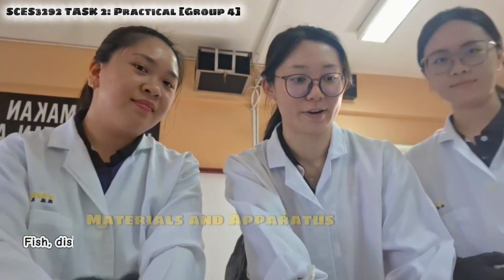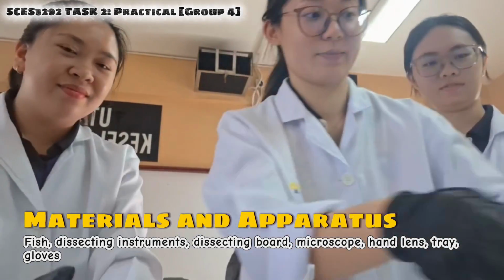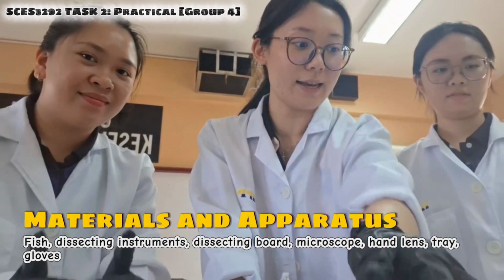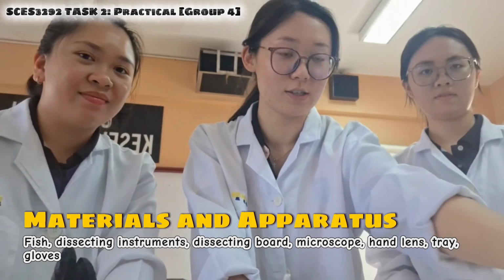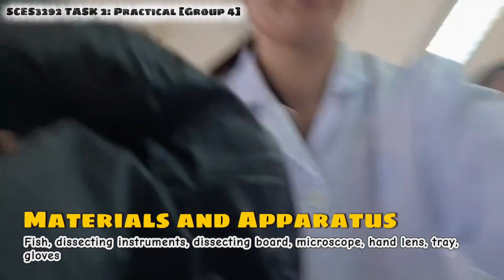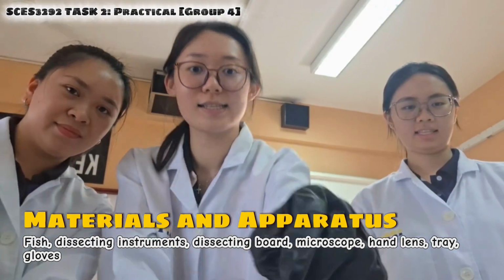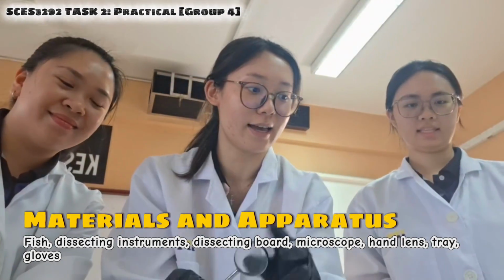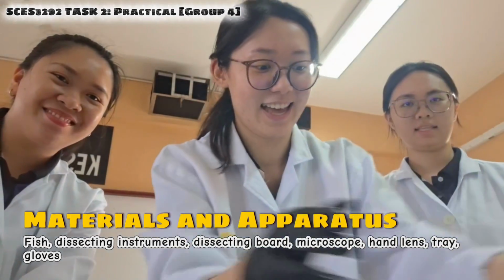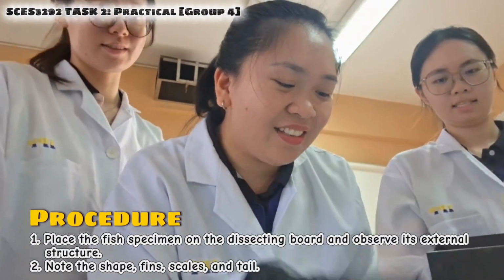For the material and apparatus, first, the most important one, we have fish. And we have dissecting instruments, and dissecting board, the black thing we have shown just now, and microscope, and hand lens, and tray, and gloves. Before dissecting the fish, we are going to observe its external structure.